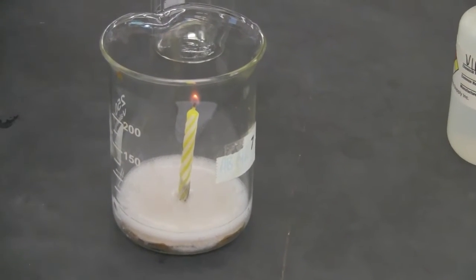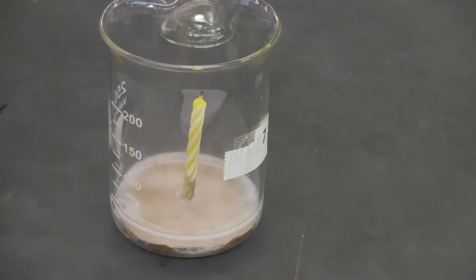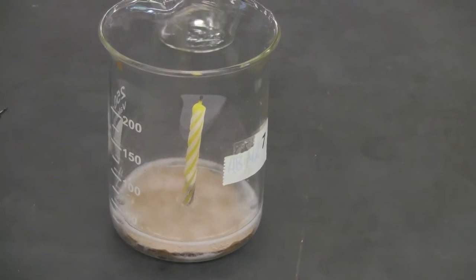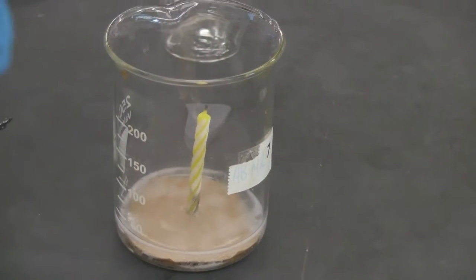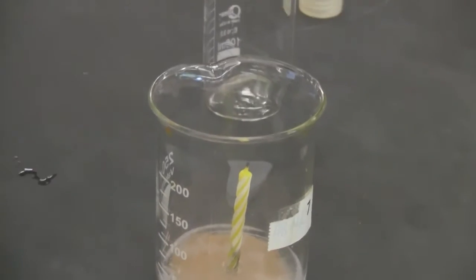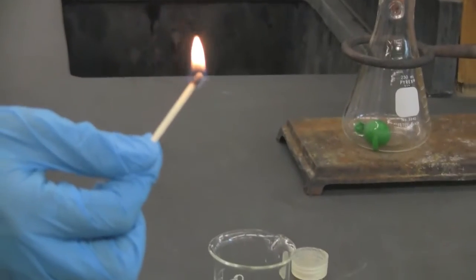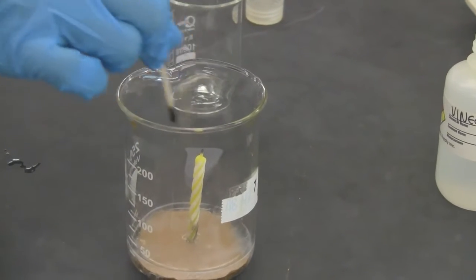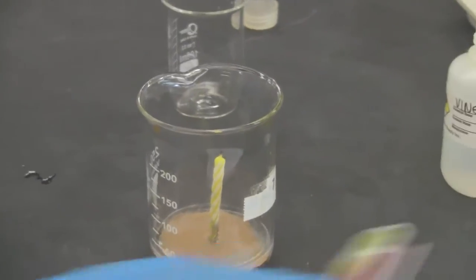We don't have enough baking soda. Okay. Now notice what happened. Okay, now let's try to reignite the candle, see if it's possible. See that? Let me do it again. You're going to think about why. Here it's ignited. But when I approach down here, it's gone. So you should think about what's in there and why I cannot relight the candle. Okay.